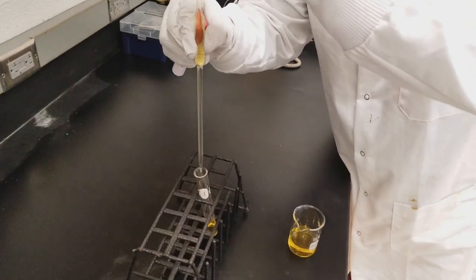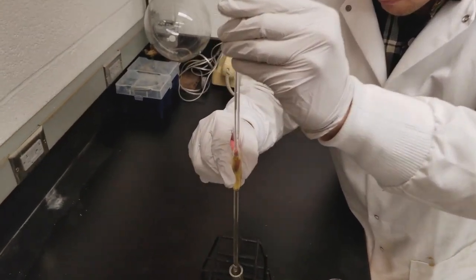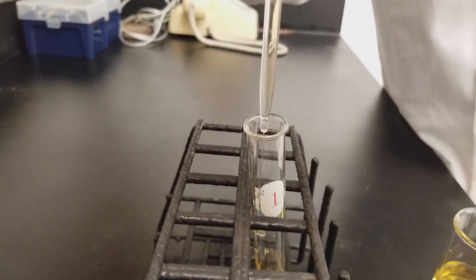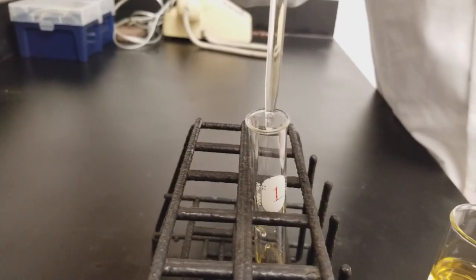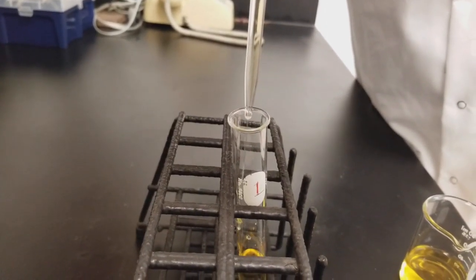As soon as you get it to that volume, place it over the container you're transferring your solution to. Then release the top of the pipette with your finger. It's important that you don't allow the pipette to touch the side of the container you're transferring into.